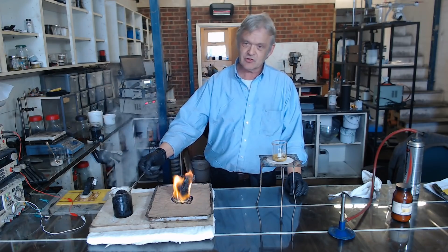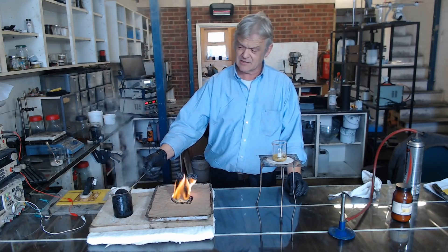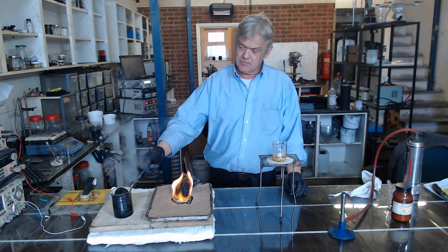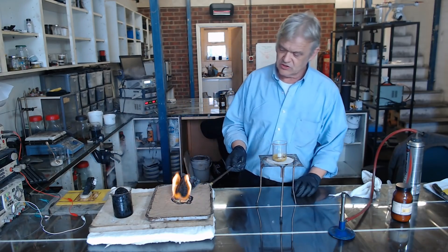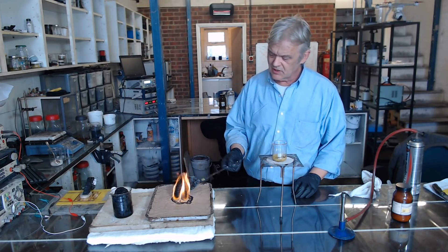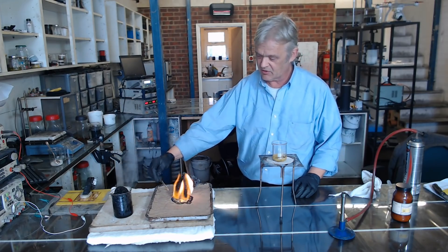This one — obviously if you want to use that carbon it's going to be pretty contaminated with sulfuric acid, so even disposal of it is going to be difficult and need care because there's a lot of sulfuric acid still left in it. This one is just burnt sugar and baking soda and it's incredibly light. It will grow quite long and produces this incredibly light carbon — the black ram's horn you can see forming there.